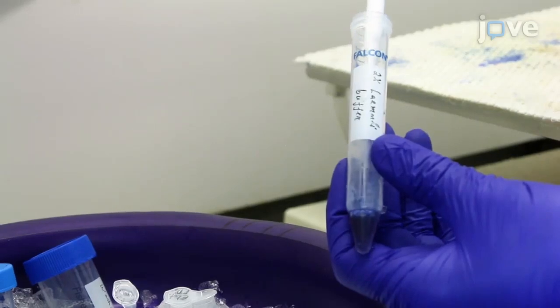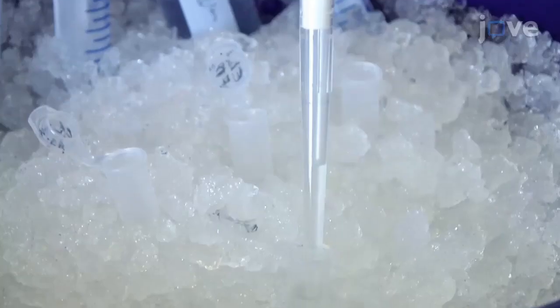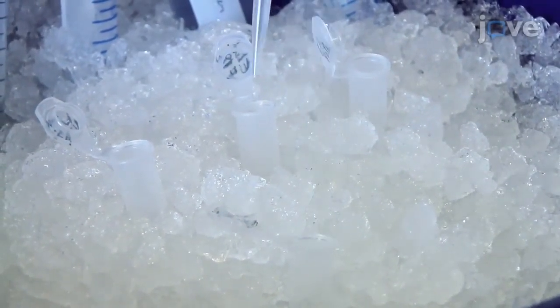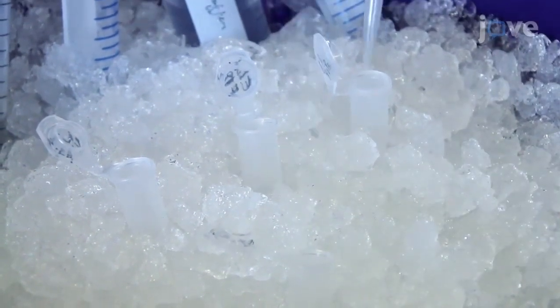The identification of proteins that bind to inositol phosphates or phosphoinositides is essential to understand how these metabolites perform their regulatory function. This protocol has a simple workflow that's sensitive, non-radioactive, liposome-free, and uses reagents that are commercially available. In this method, affinity chromatography with biotinylated inositol phosphates or phosphoinositides is used to isolate interacting proteins that are then identified by Western blot or mass spectrometry.